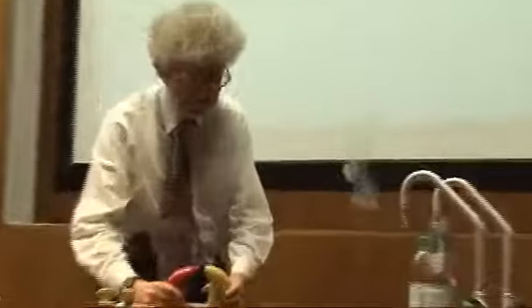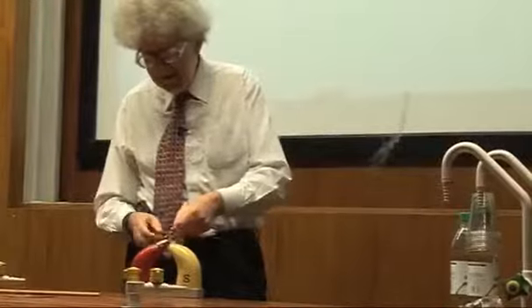So this is liquid nitrogen, and what I hope you can see is that this magnet, which is a pretty good magnet, let me just show you here with my keys, that they stick pretty strongly to the magnet. The magnet has absolutely no effect at all on the liquid nitrogen. I can pull the magnet and nothing happens.